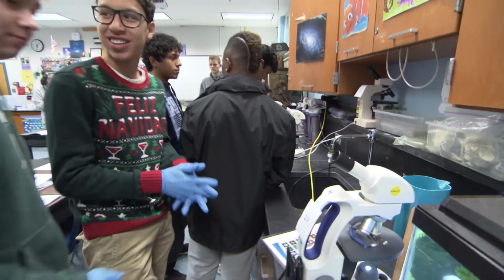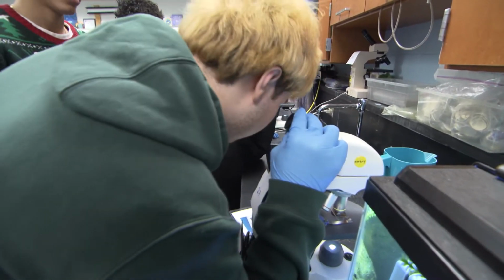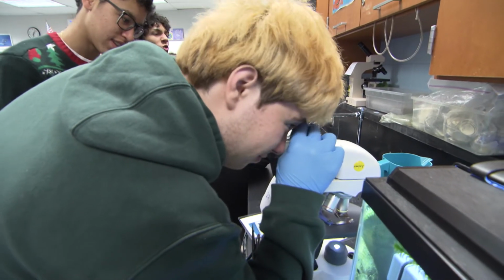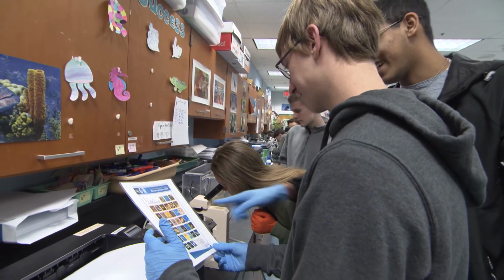Only the scanning and low objective lens should be used. The highest power tends to obscure the microorganisms. Have them identify the microorganisms they see using the poster provided.